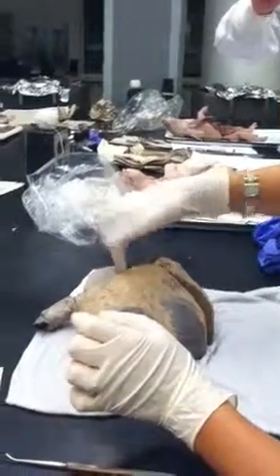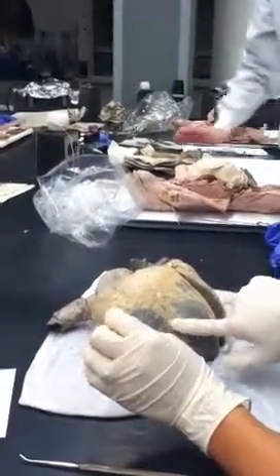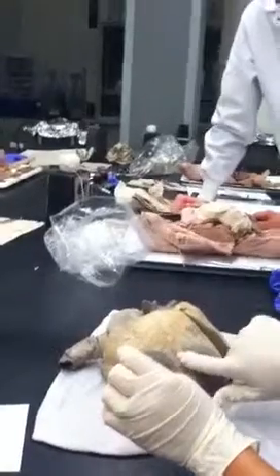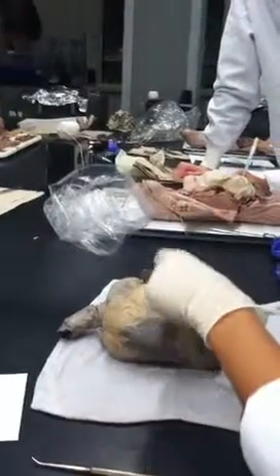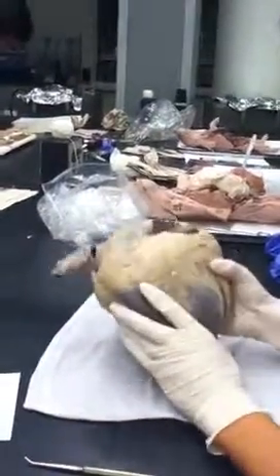But coming along right down here, you have an artery and a vein. Anyone know the names? It's the left coronary artery and the great cardiac vein. So if we put a pin on those in the fetal heart, then you would have to say that. We can't do that here because they're not there. Okay, so we're going to trace some blood.